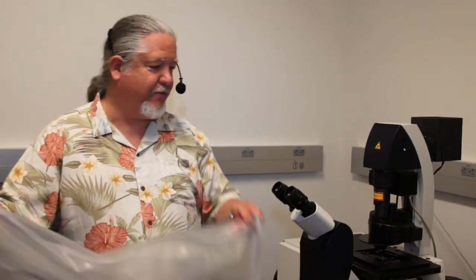Finally to protect our microscope, we use the dust cover to keep dust and debris off the instrument while it's not in use.